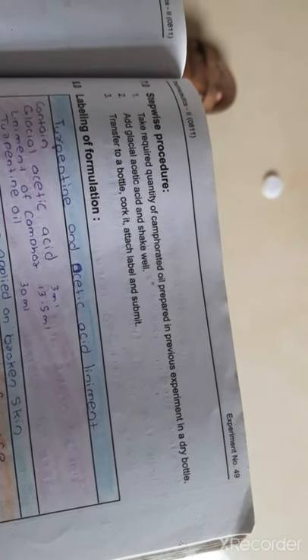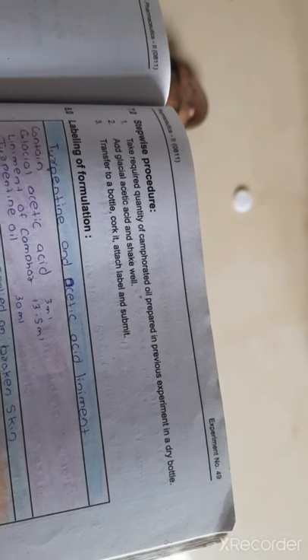The liniment of camphor already contains turpentine oil, so we don't require any new addition. We have already prepared 30 ml of camphorated oil. In that, we have to add only glacial acetic acid — 3 ml. So that is our complete procedure.